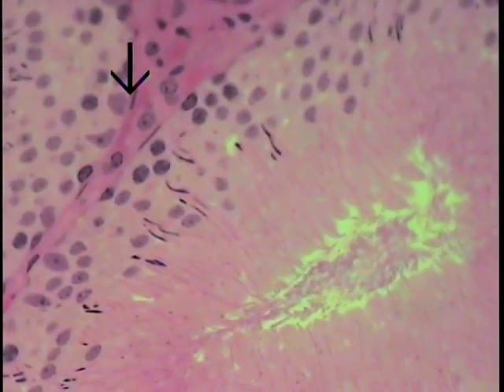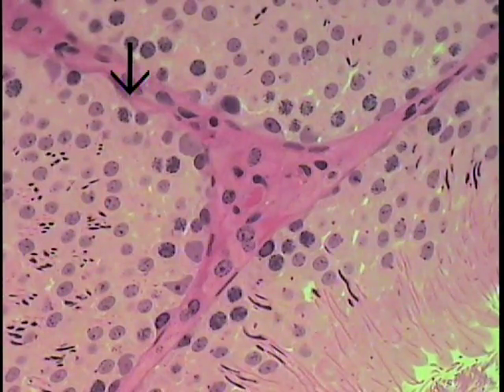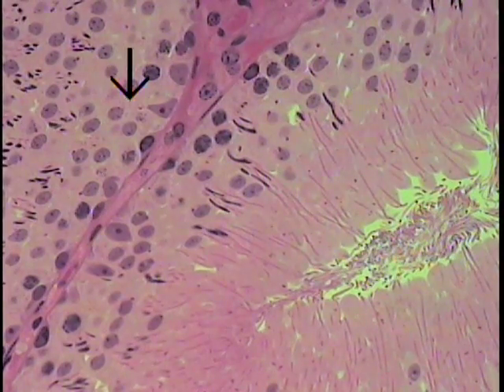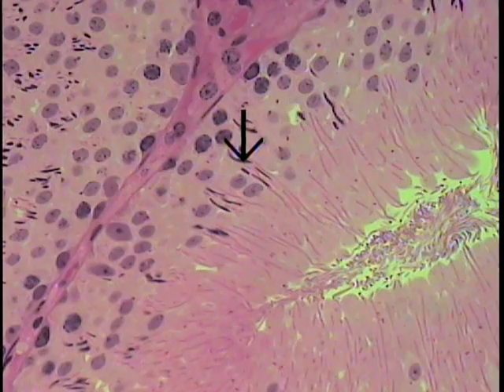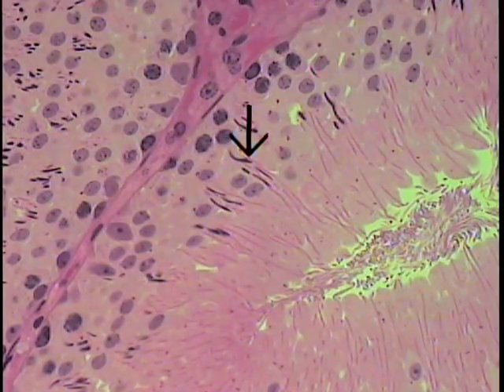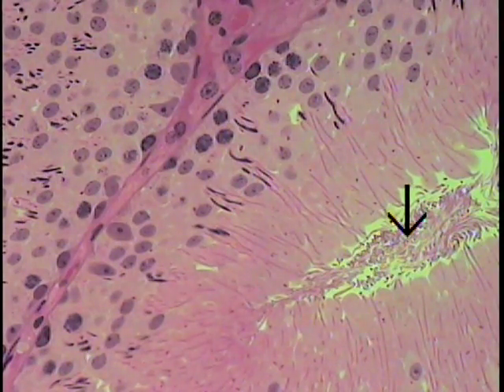So those are some of the cell types one can see quite easily when you examine this particular section under the microscope. Here we can see these are a little bit more mature late spermatids — you can see the nucleus here, and if you look very carefully, this little thin line coming up here is the tail or the flagella of these spermatozoa. They will then migrate up and be released into the lumen, which contains the tails of numerous spermatozoa. This is a portion of the lumen of a seminiferous tubule showing you the cross-sections of the tails of numerous spermatozoa just prior to being released into the seminiferous tubule.